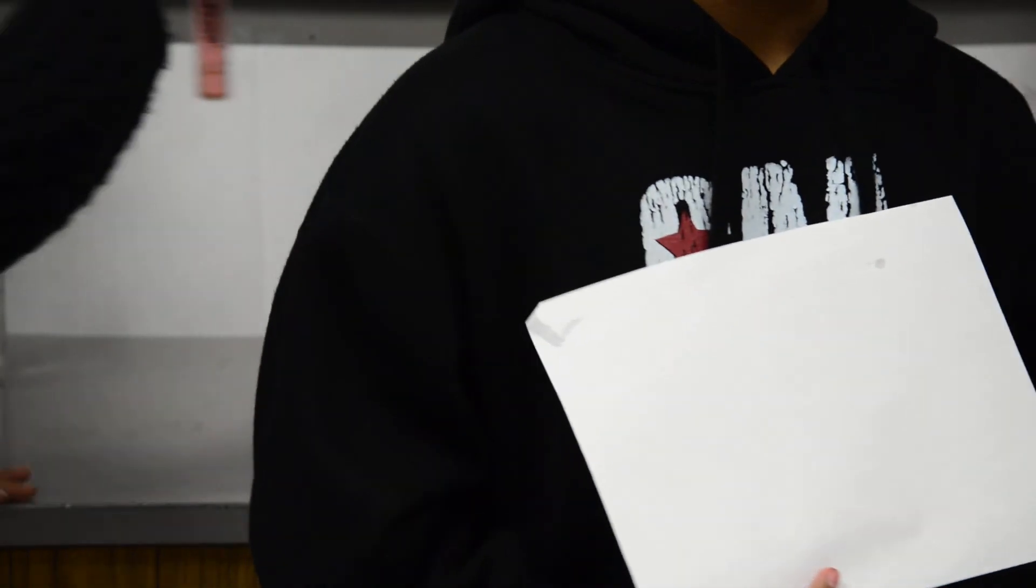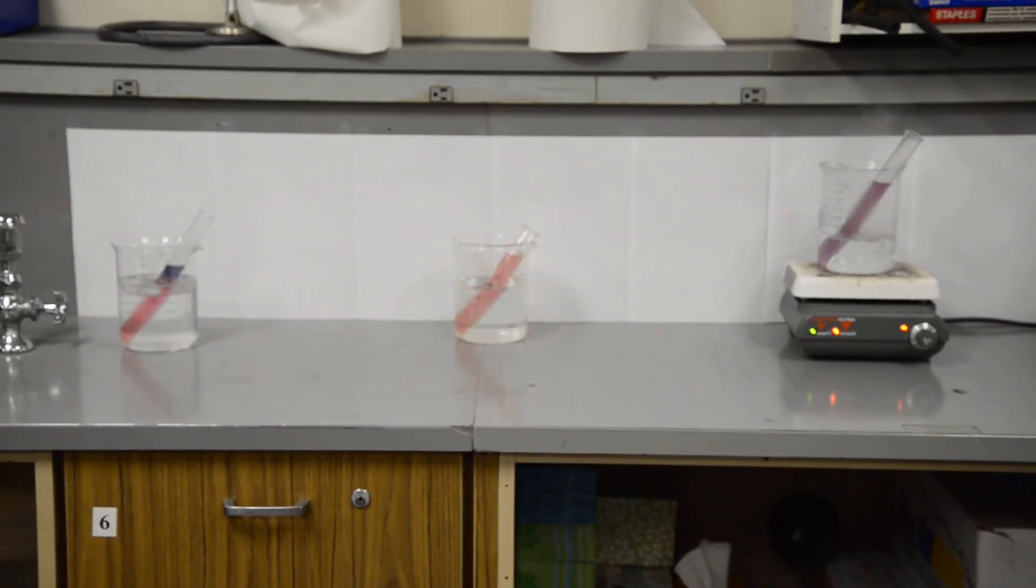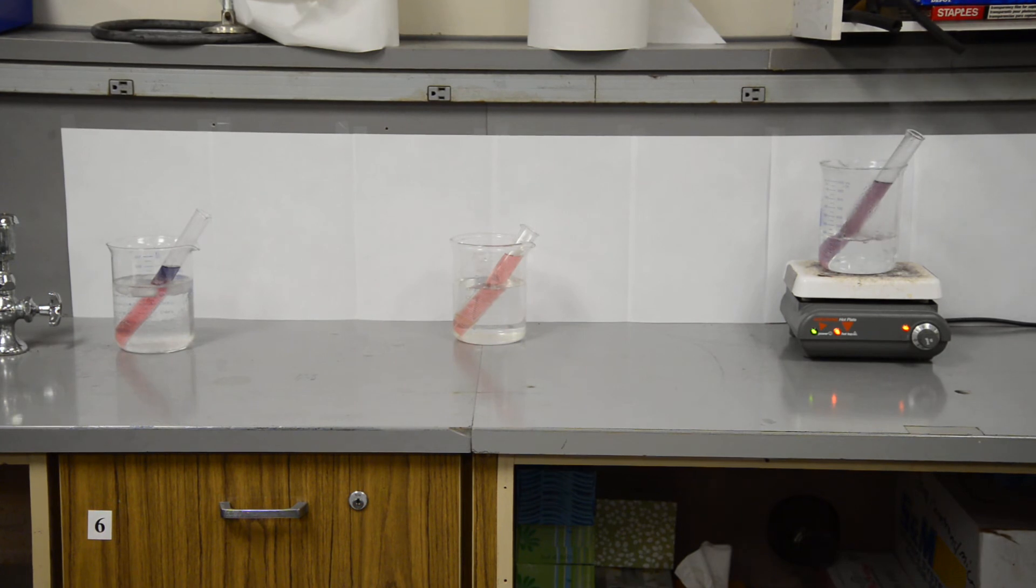Yours goes back in the regular room temperature. And as we watch, we're actually seeing this thing change before our eyes. That pink is gone all the way up to the water line.